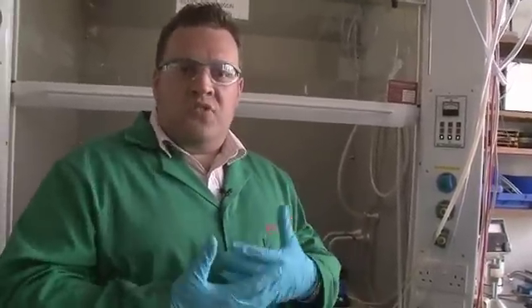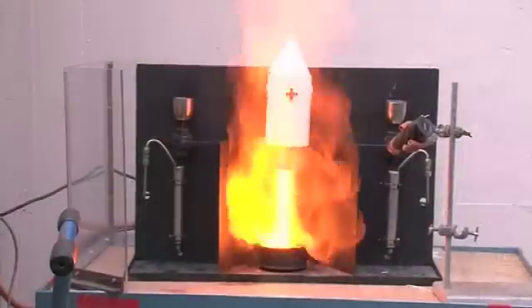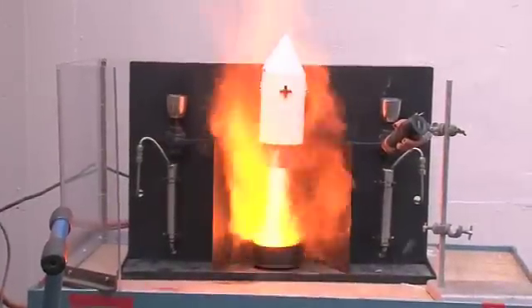Hypergolic reactions are really useful and you find them all over the place in jet motors and rockets and things like that. We thought we'd show you one today in the lab.